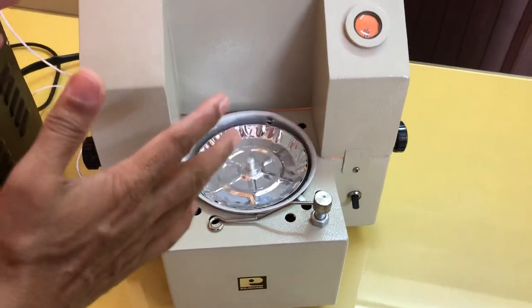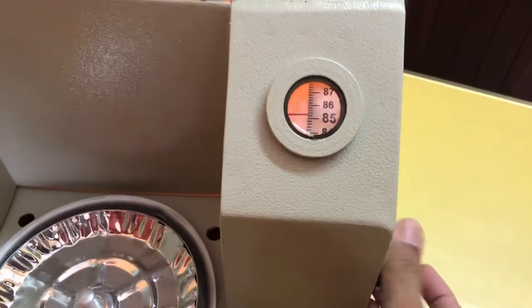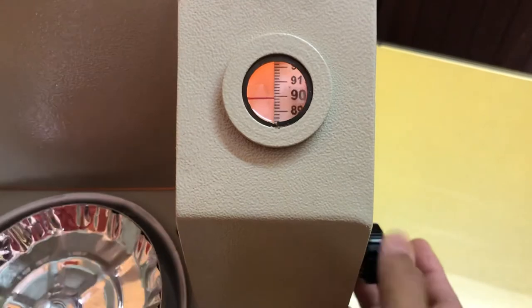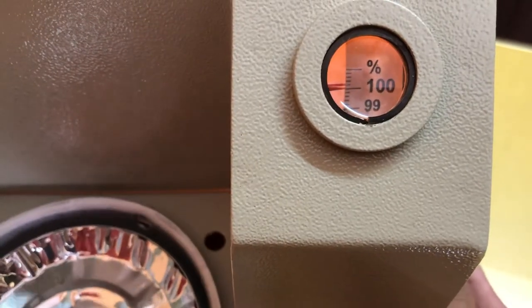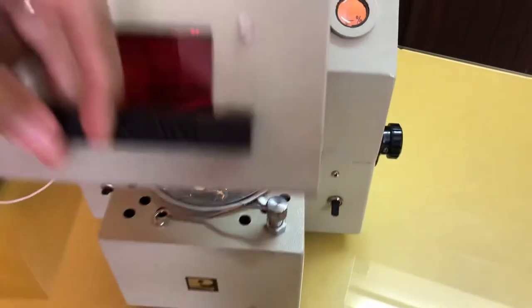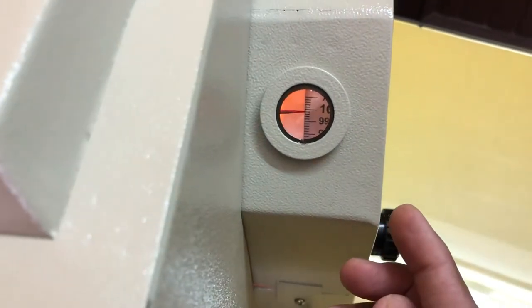To start operation, first we have to bring 100 of the scale to coincide with the reference mark. When you rotate this right-hand side knob, this scale will rotate — as you can see, the scale is rotating. So the first step is to bring 100 of the scale coinciding with the reference mark. Now, as air is flowing, the pointer is moving. What we do is we just close this compartment. And now, if the pointer is somewhere above or below, then by rotating this left-side black color knob, we have to coincide that pointer with the 100 mark or the reference mark. This is the second step.